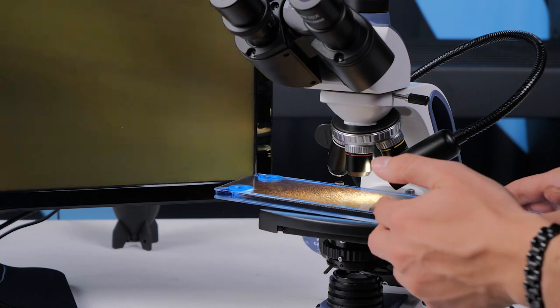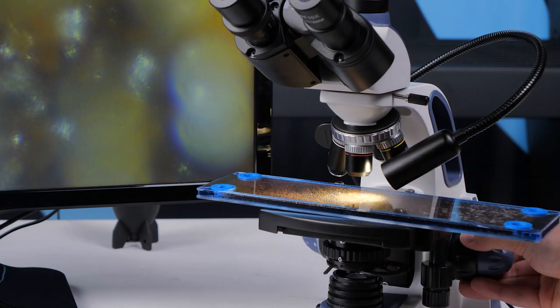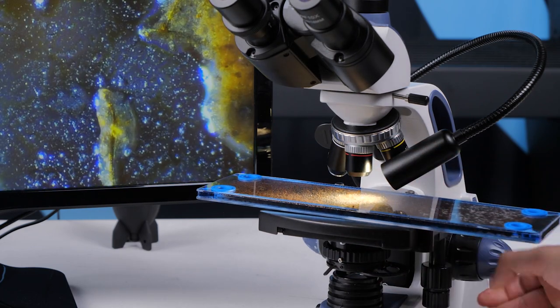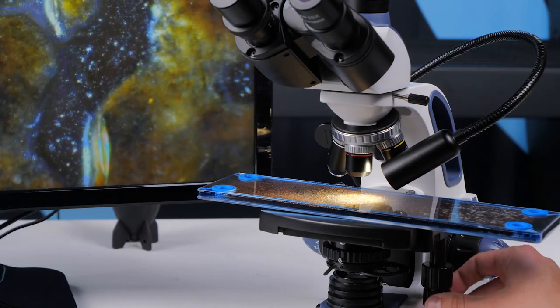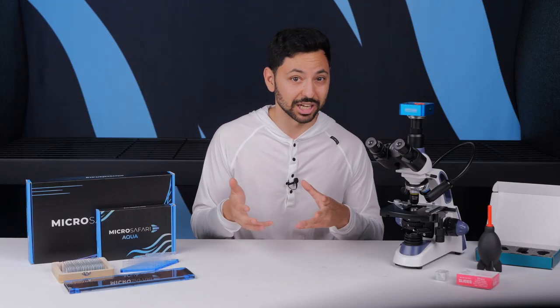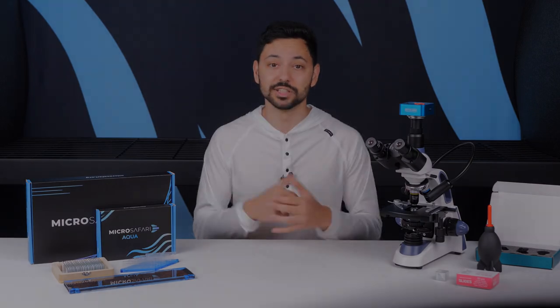Take care when manually repositioning Terra on the top of the stage. The acrylic can be scratched if you slide it directly on the metal while applying downward pressure. Don't worry about scratches too much though, they don't really substantially affect the optical quality of this sample.